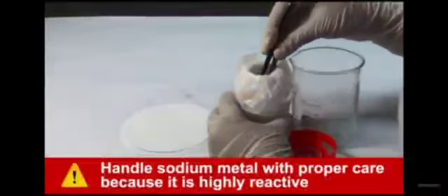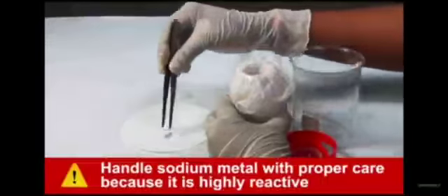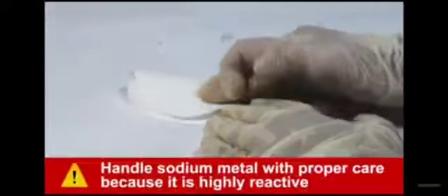Take a small piece of sodium metal using forceps and place it on a piece of filter paper. Dry the sodium metal by pressing it between the folds of the filter paper. Now, put the dry piece of sodium into the organic compound using the forceps. What do you see?